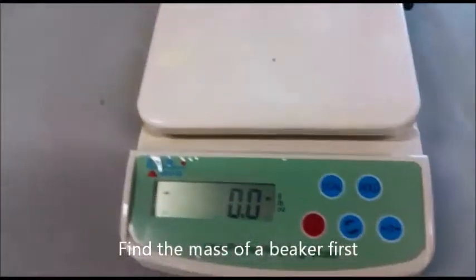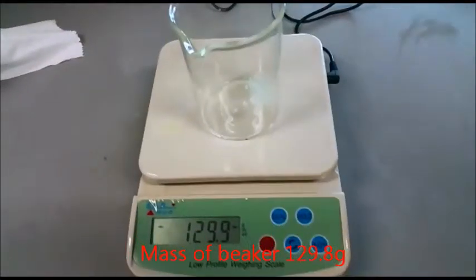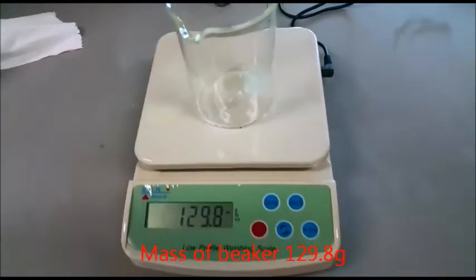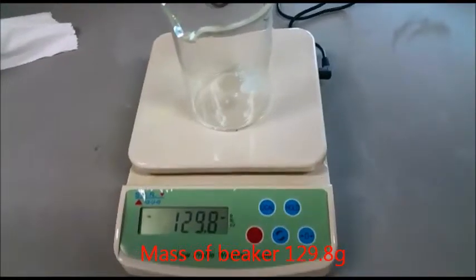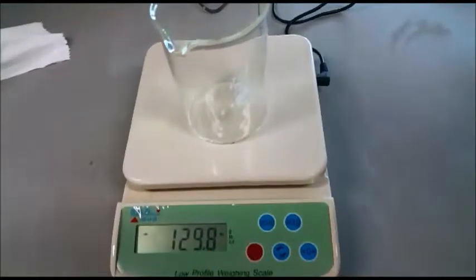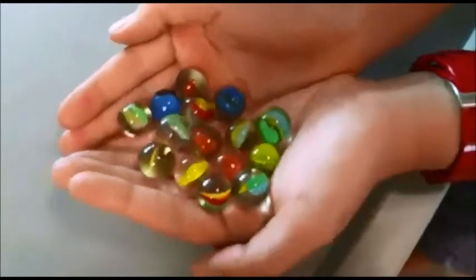To find the mass of 15 marbles. First, find the mass of the beaker. The mass of the beaker is 129.8 grams. Find the mass of the beaker plus 15 marbles.